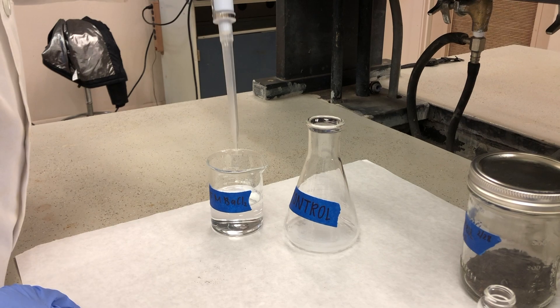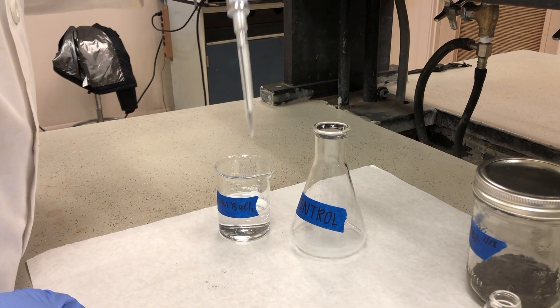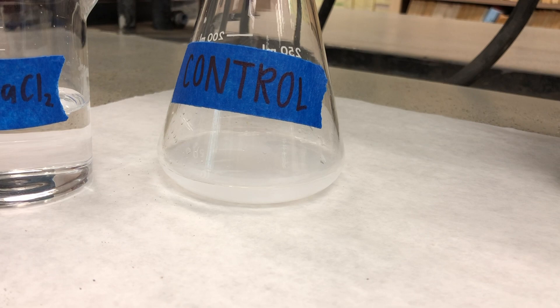Add 10 milliliters of barium chloride to each flask. This will result in the formation of a precipitate, turning the solution cloudy white.